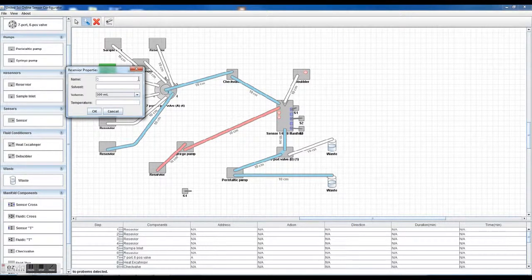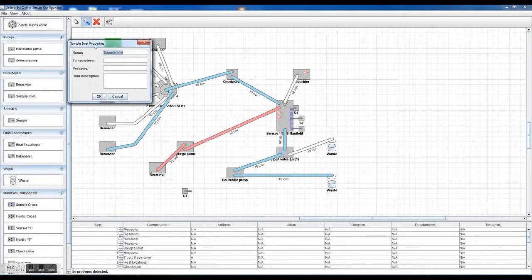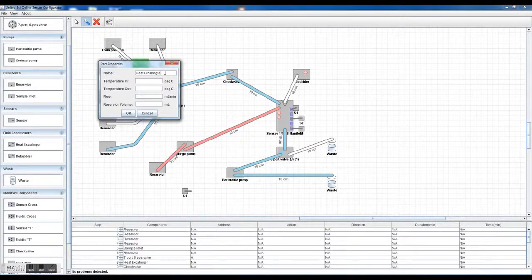Calib 1, so this is going to be Calib 1. I can have either a 1 liter container, and I can say it's at 25 degrees coming at the inlet. But at the same time, I can have something like "from process" as the name, and I'd say I'd have 100 degrees Celsius coming in, at say 10 bars, and then I'd have maybe a water solution. Okay, and then I check out my heat exchanger, temperature incoming out.